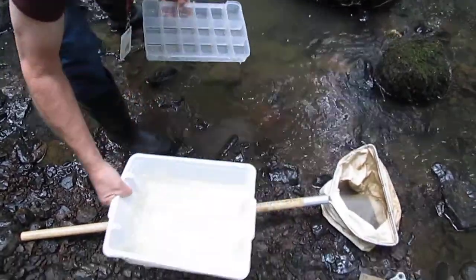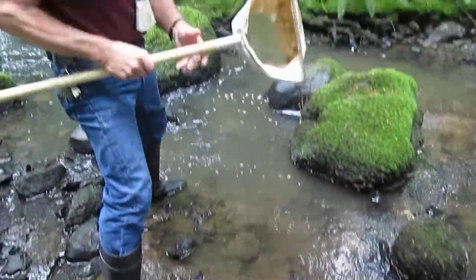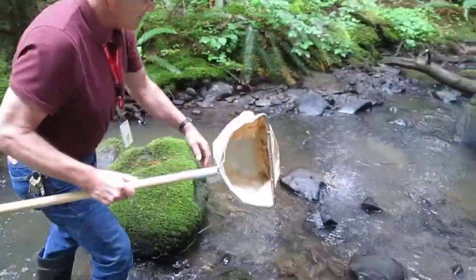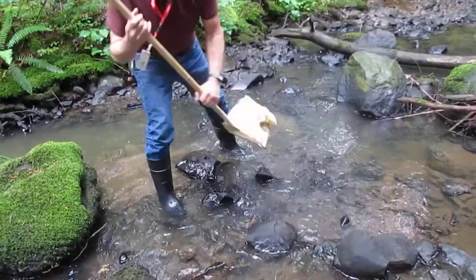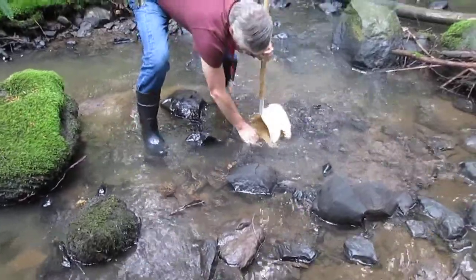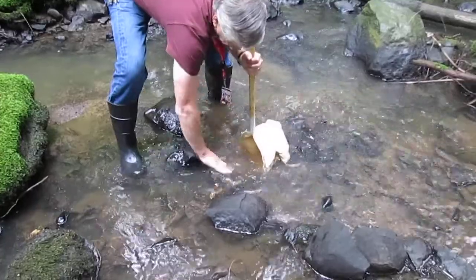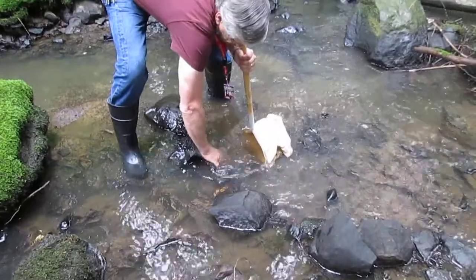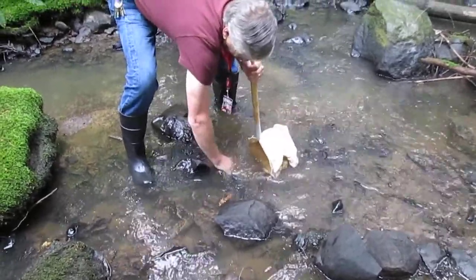Now we are going to start collecting macroinvertebrates. To do that we are going to use a D-Net, called a D-Net because it is shaped like a D. We are going to go to a place in the creek where water is moving, put it firmly at the bottom of the creek, and for about 30 seconds stir up the water, rub the rocks, get all those bugs into the D-Net. The D-Net should be facing upstream.